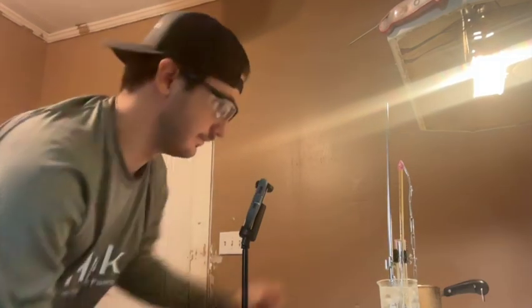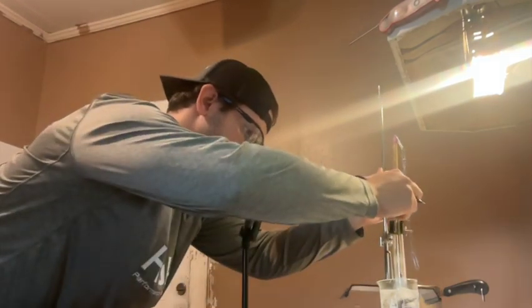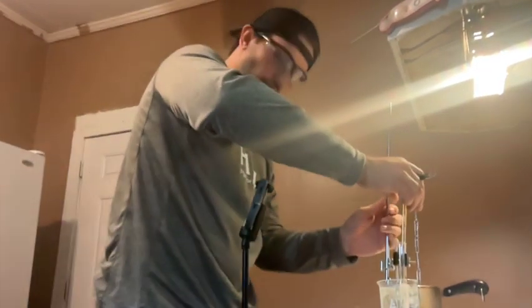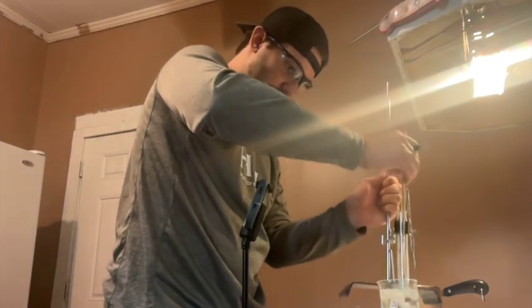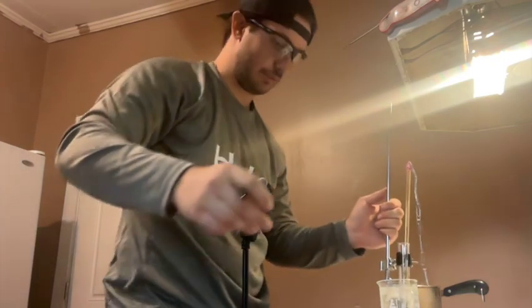It's at 48 degrees now after 2.5 minutes, and it's almost completely frozen. Now at 3 minutes, it's been completely frozen.